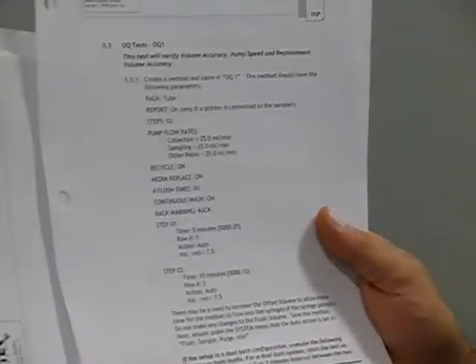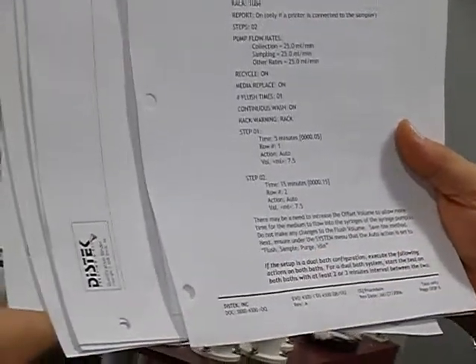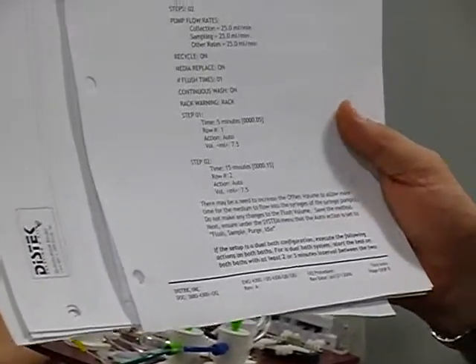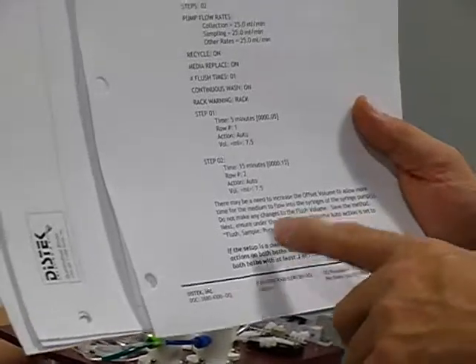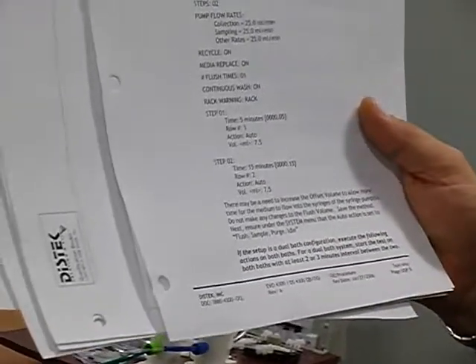All right. So if you're ever in, I always check it just in case a customer was playing around, you know, it's a new instrument, they want to play around and touch all the buttons, and then they've changed something. And then they wonder why, oh my God, something's not right, your volumes are way off. These are all the little things I check, stuff that I know they can easily just hit.